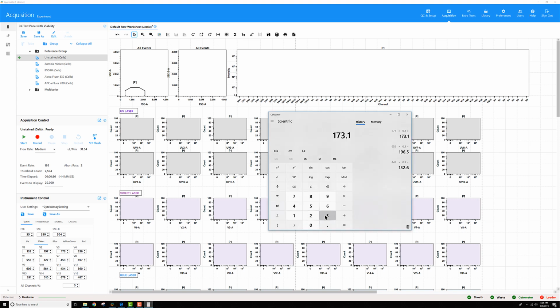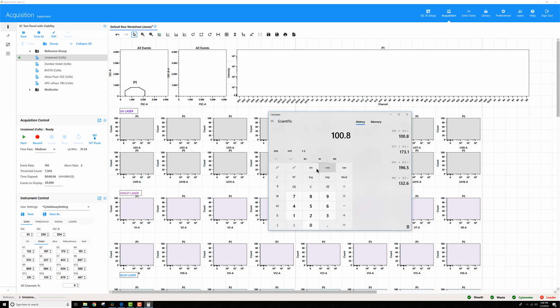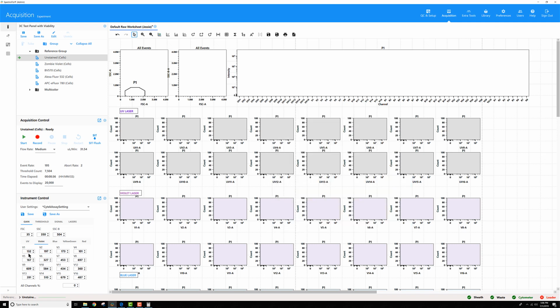On to V4, I'm at 336. 70% reduction leaves me with 30%, which is about 101. V5 is the last one I wanted to change. I was at 555. Again, take a 70% reduction, so 30% remains. It's about 167. Okay, so this way, by reducing only V1 through V5, I'm still preserving a lot of these optimal signal-to-noise gains that we Cytek optimize for you for V6 through V16, which will help us with any dyes that we have with a lot of signal in these later channels.